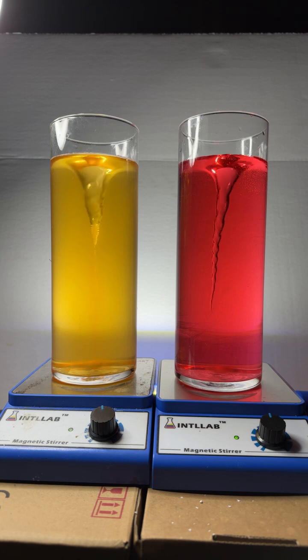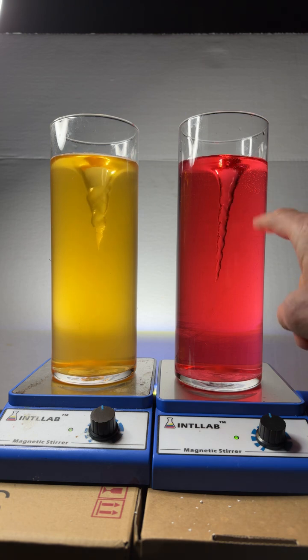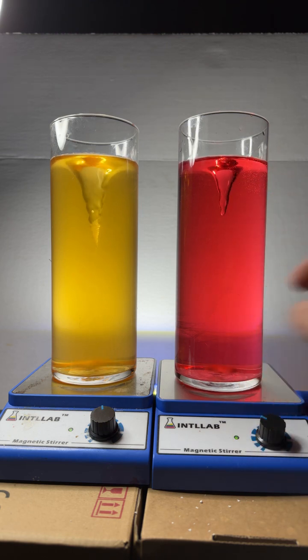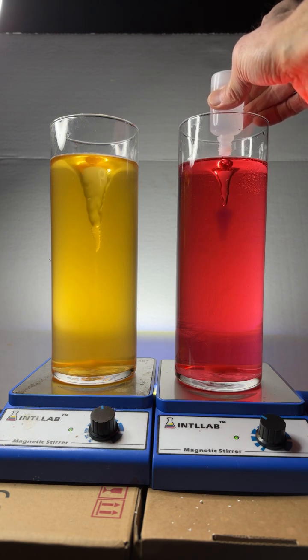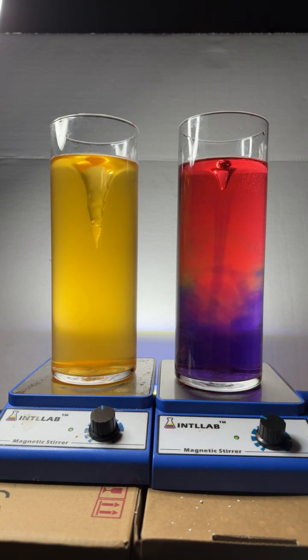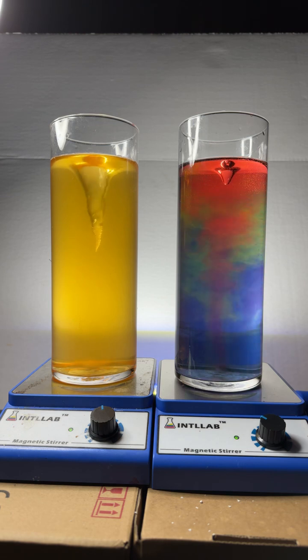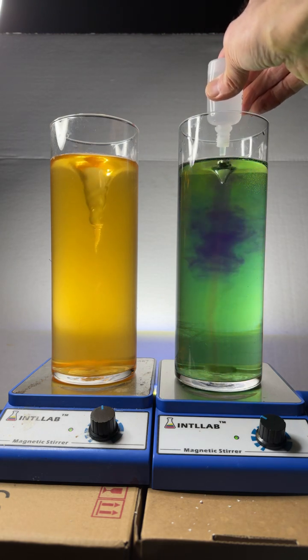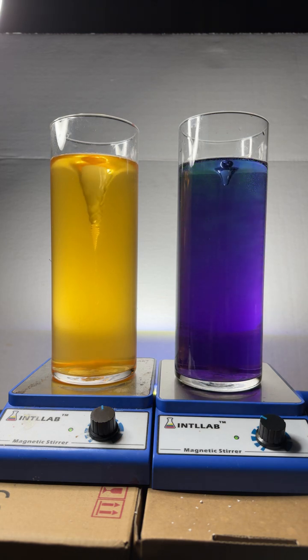What's kind of fun is these reactions take a little bit of time — the acid and base reacting with each other takes a bit of time. So if I turn the stirrer speed down and add base, we may be able to see the whole rainbow because it takes a bit of time. Let's see if we can get the rainbow going — one, two, three, four, five drops — and I think we did it! It's really pretty. So we got yellow for you on the left and purple on the right — yellow feet, purple bananas, this one's for you!